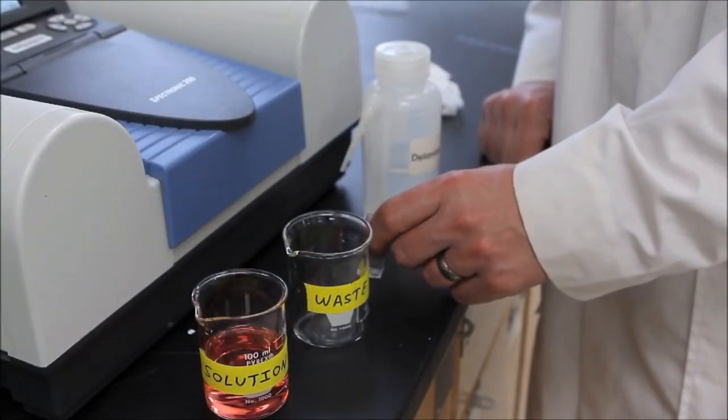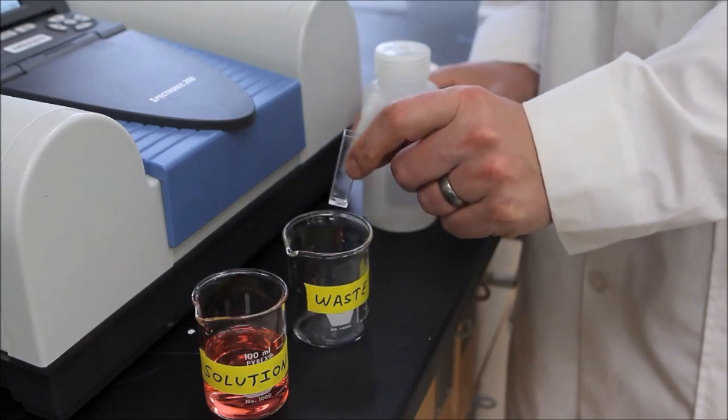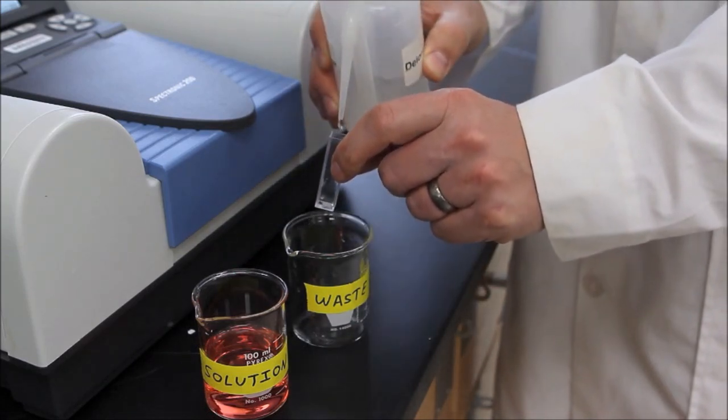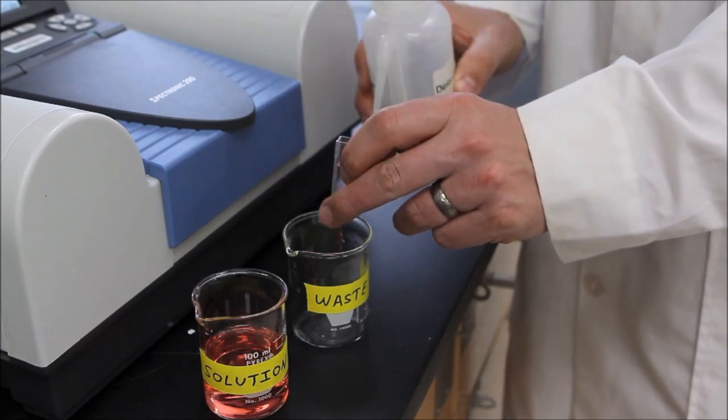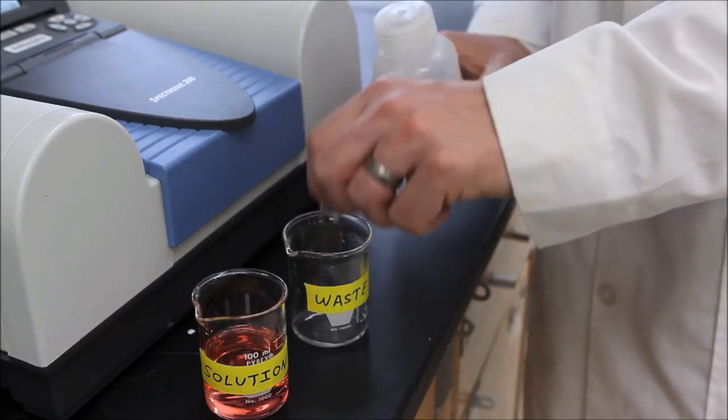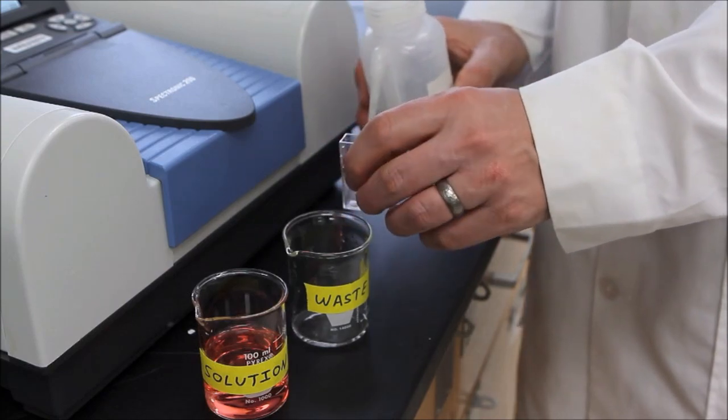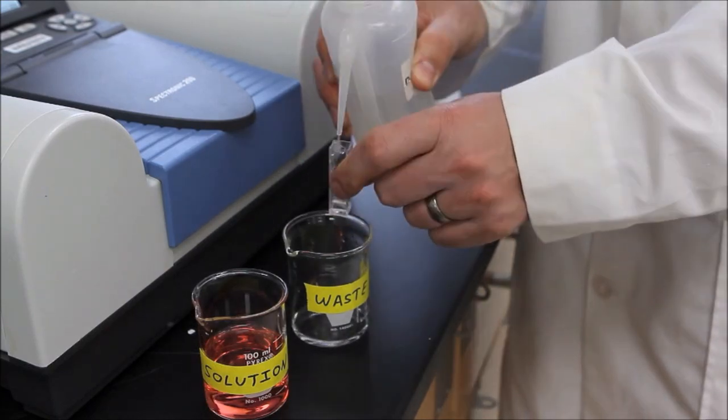We are now ready to clean the cuvette. Hold the cuvette by its frosted sides and fill the cuvette with a small amount of deionized water. Empty its contents into a waste container and repeat this cleaning step two additional times with more deionized water.